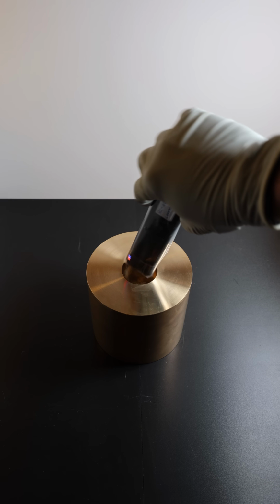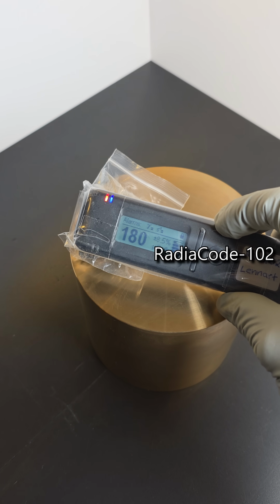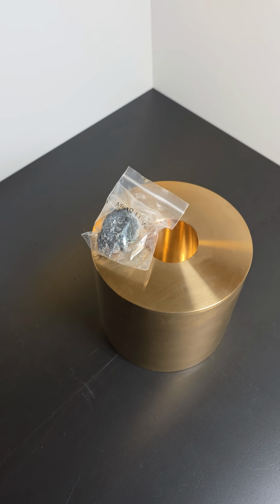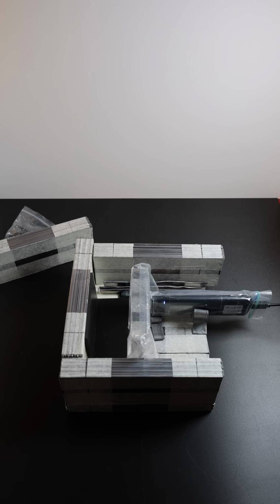Our piece of primary uranium ore here is a relatively safe source of gamma and X radiation. Together with our RadiaCode-102 gamma spectrometer, we will try to analyze this strange coin from a country worshipping old women and maple leaves. Please keep in mind that this is not an ideal setup. The energy resolution of this device was never meant to differentiate between tiny differences in soft X-ray energies.